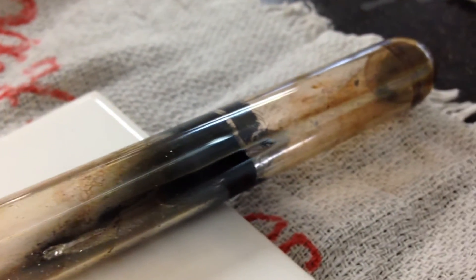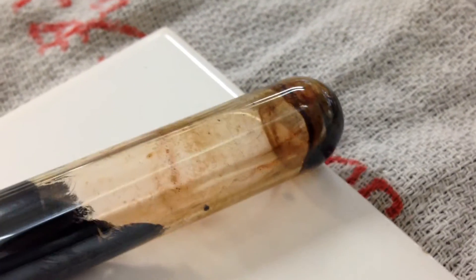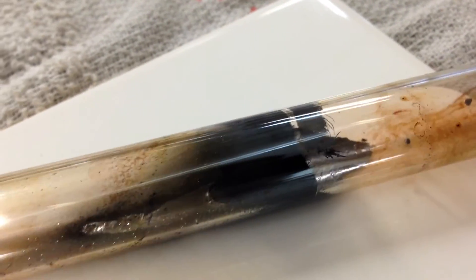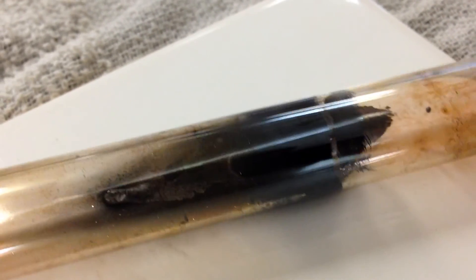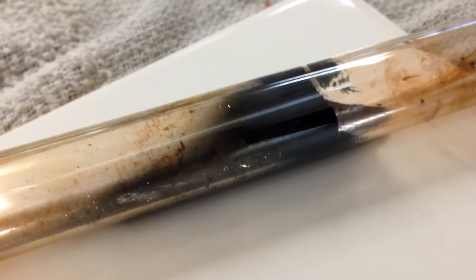Upon cooling, the iodine vapor forms iodine crystals on the cooled walls of the test tube. Notice how the iodine crystals have traveled from the bottom of the test tube to the upper portion of the test tube. The reverse of sublimation is known as deposition.